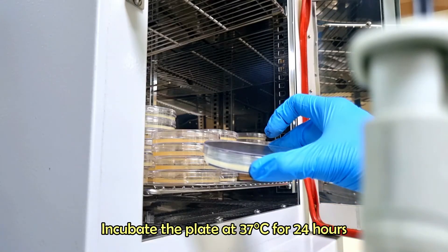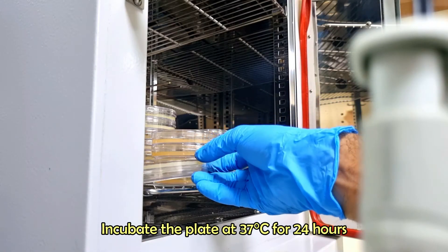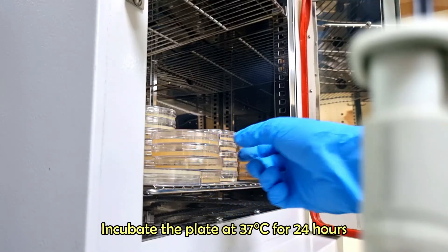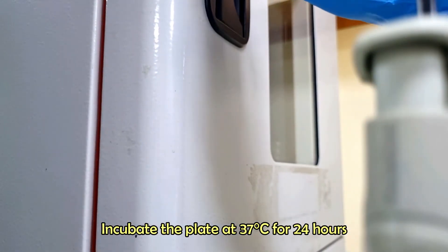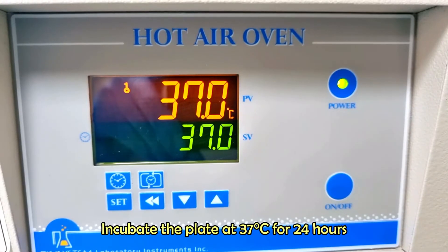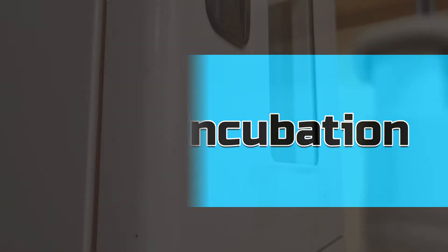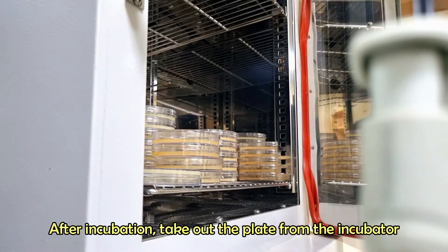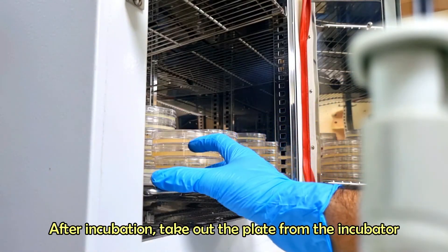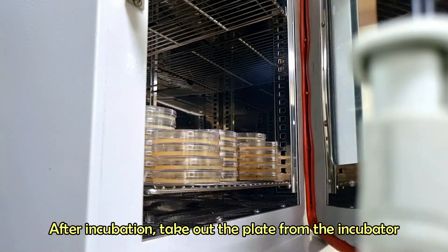Incubate the plate at 37 degrees Celsius for 24 hours. After incubation, observe the plate and count the bacterial colonies.